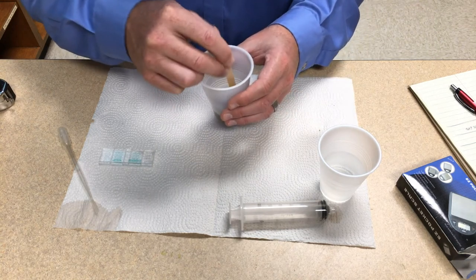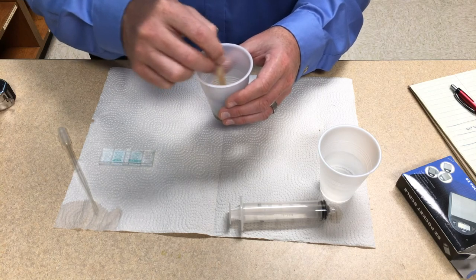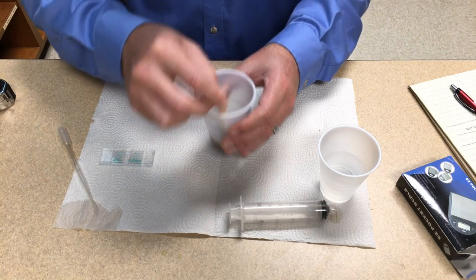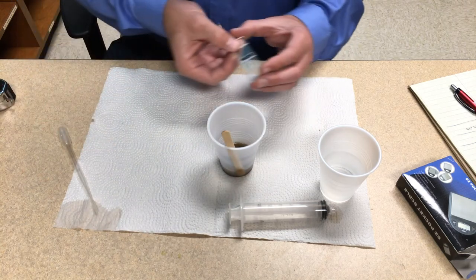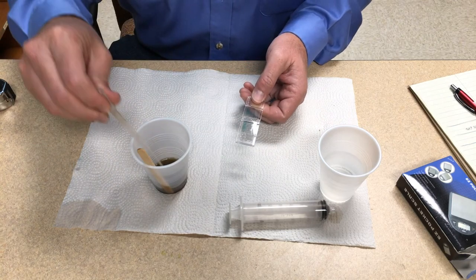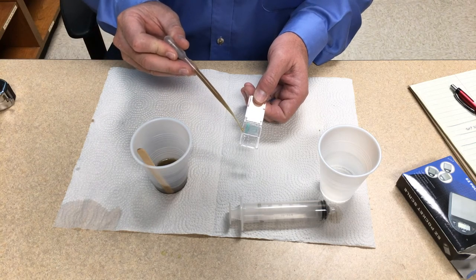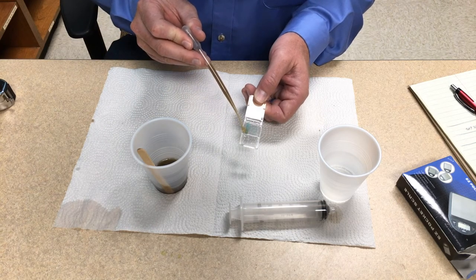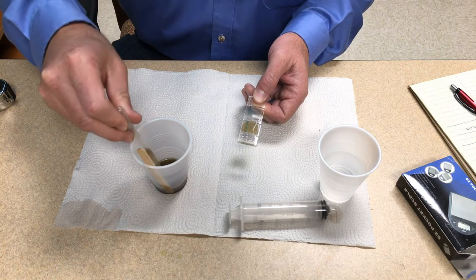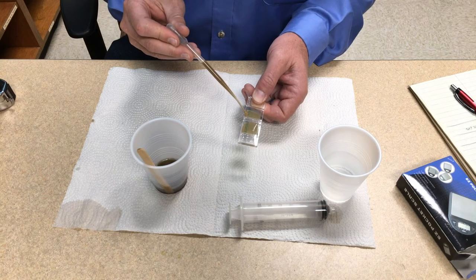Now you're ready to add the solution to the McMaster slide. I like to stir it up about 25 or 30 times immediately before I draw the solution out. You'll use the pipette for this, and I like to try to draw from about the middle of the column of water. There's a little bit of finesse to getting the solution to go into the chamber and not over or under it, but with some practice you'll get there. Then I refill the pipette to fill the other chamber.